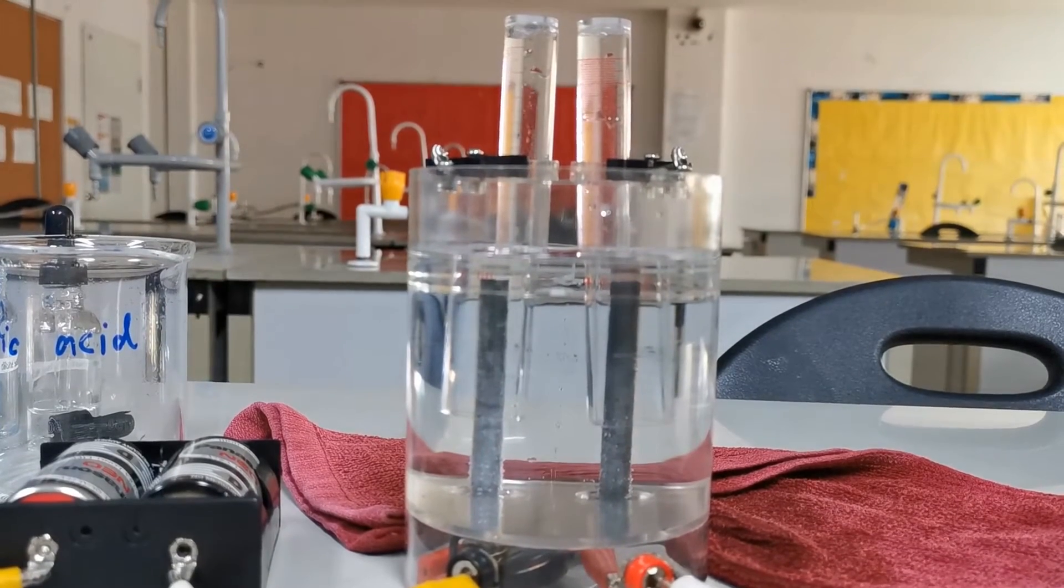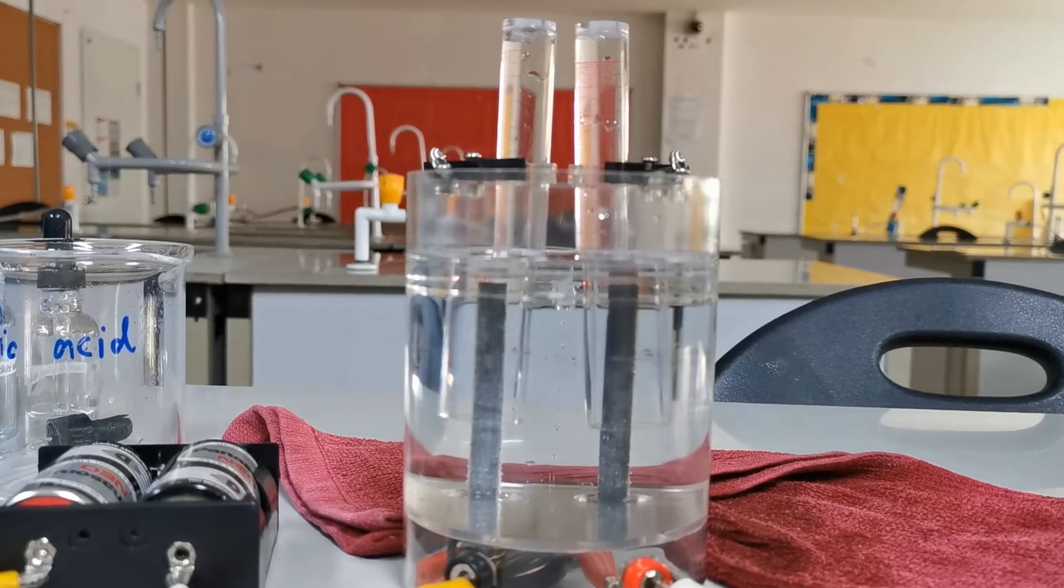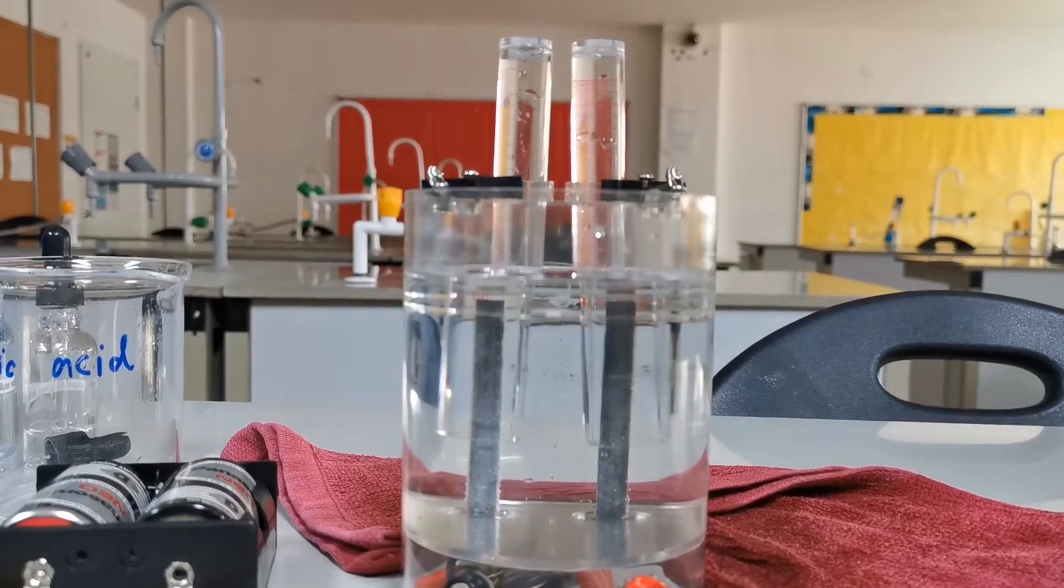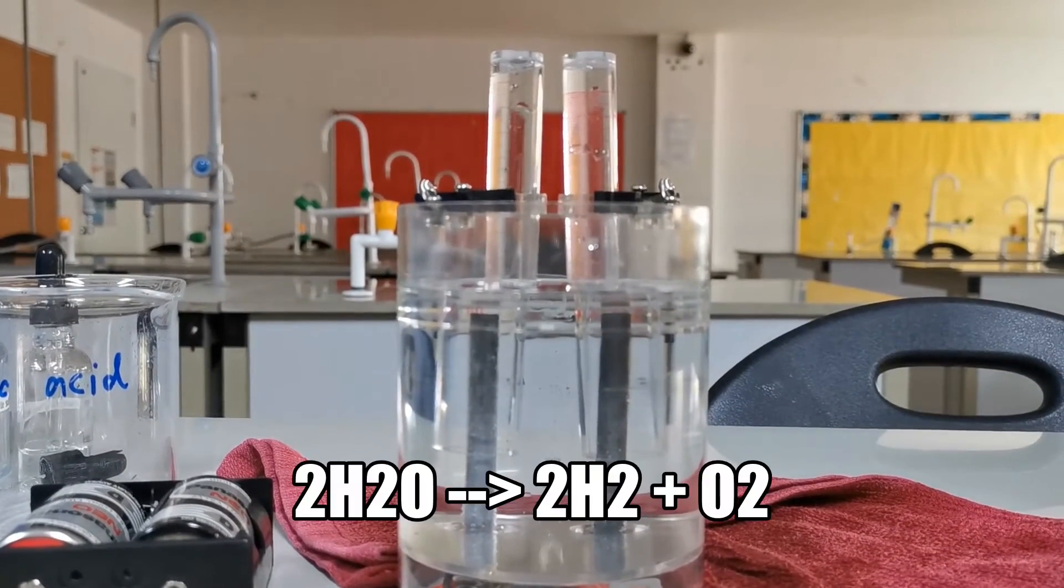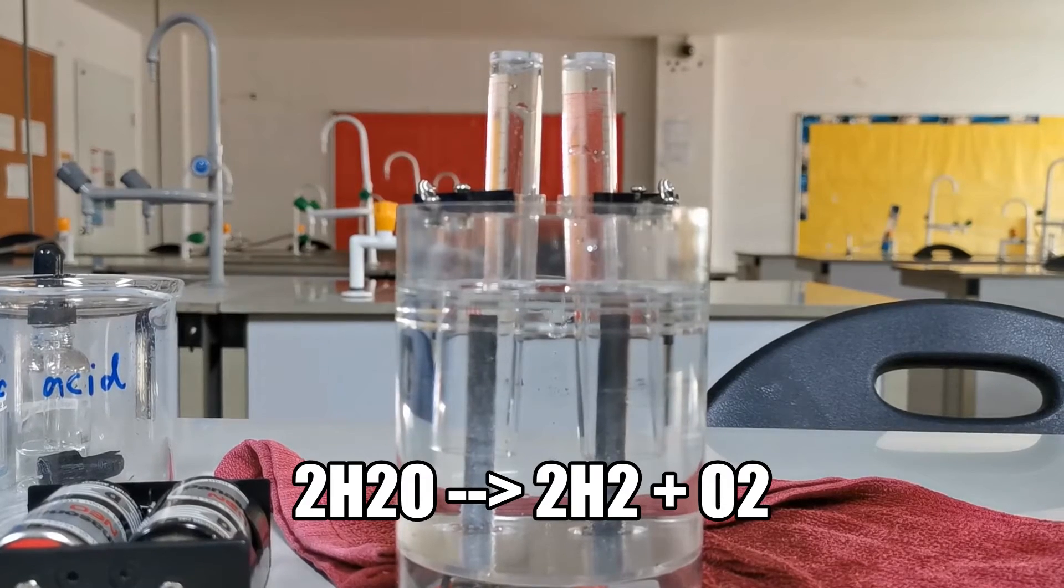So actually when we are electrolyzing dilute sulfuric acid, we are electrolyzing or decomposing water to become hydrogen and oxygen.